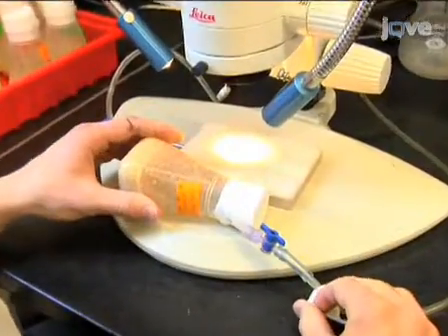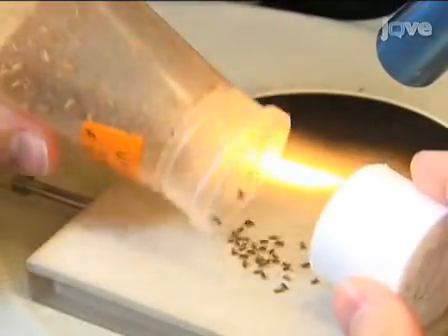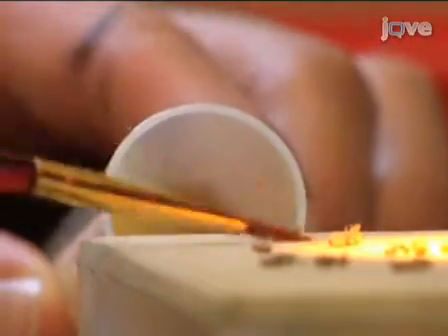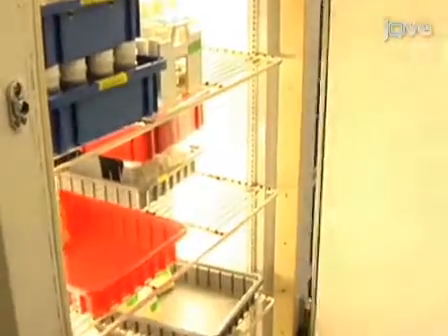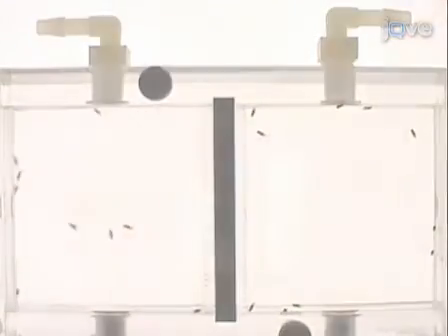Collect the flies 1 to 3 days after eclosion. Use a carbon dioxide diffuser to sort flies into test tubes containing yeast-free media. Sort 10 males per test tube. Wait at least a day or two after use of carbon dioxide before running the behavioral experiments. Once the flies have been collected and sorted, they can be run in the video tracking system.